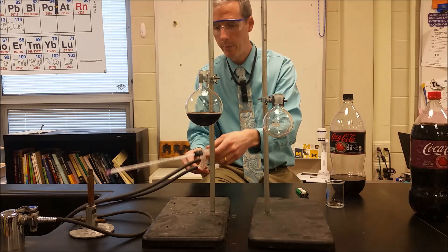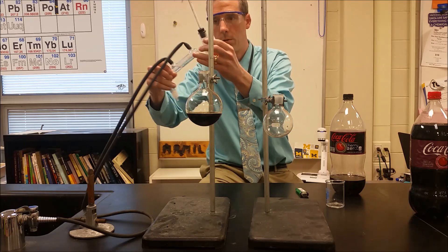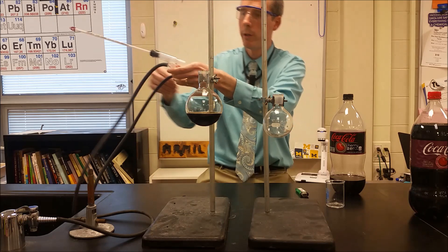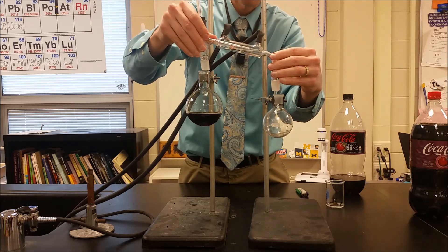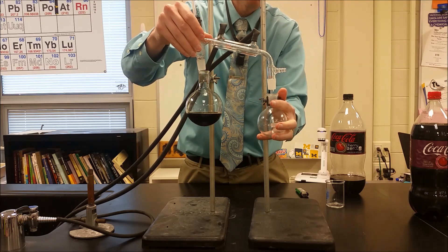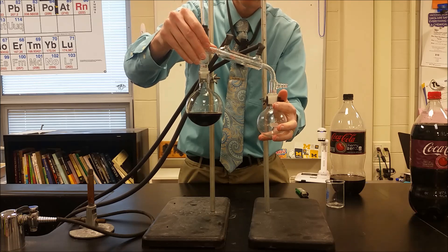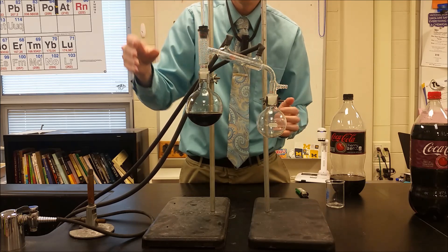So to set up the distillation apparatus we have this thing right here and all we're going to do is put this into our two containers here. We need to make sure that they can hold this without too much stress. There we go.